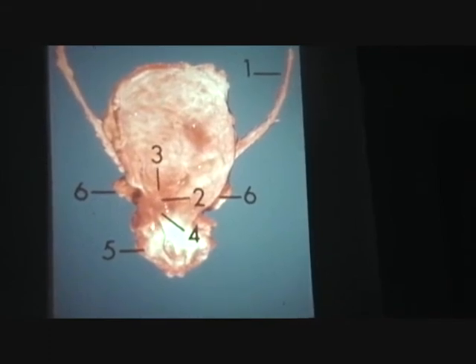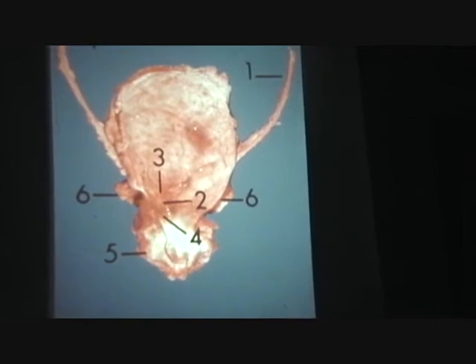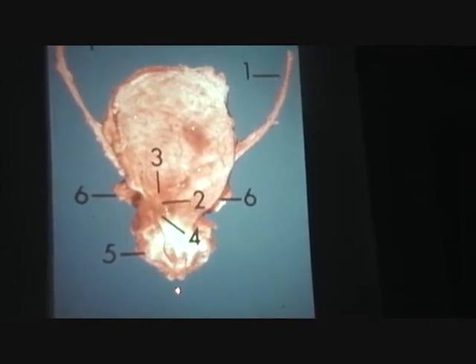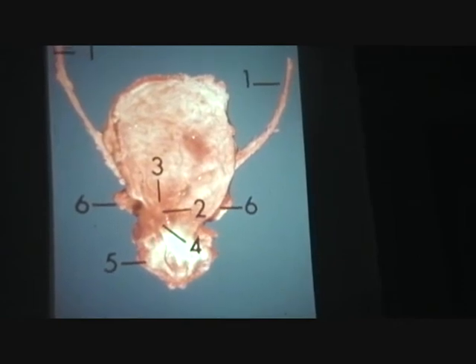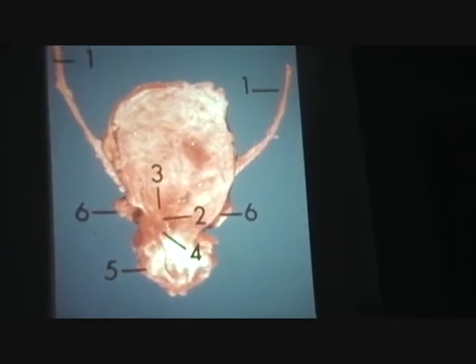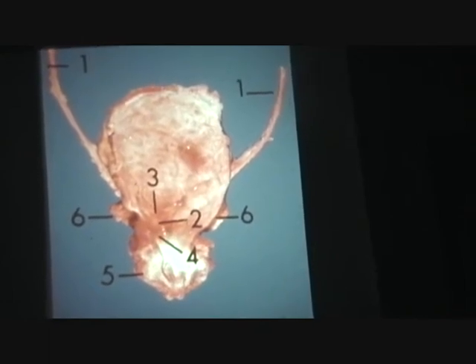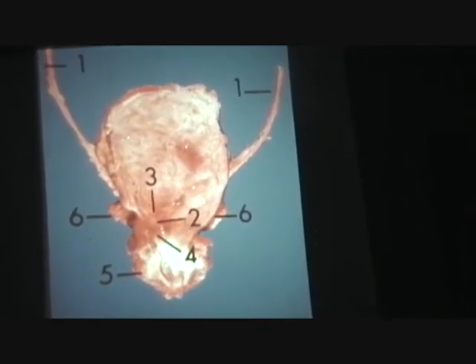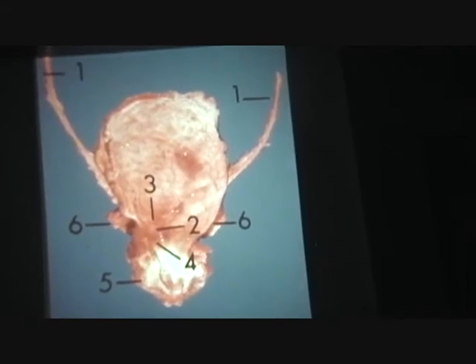There. So this is a cut open prostatic area where the urethra is seen to be right down through the center of it. This is why any enlargement of the prostate immediately starts blocking the urethra. Got to get in and cut it out. So that tells you it's got to be male prostatic tissue.